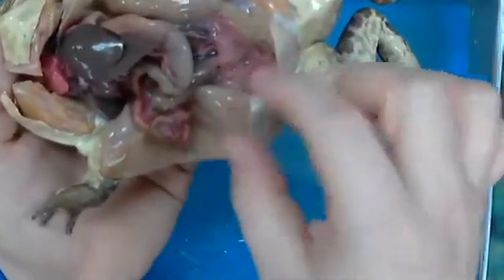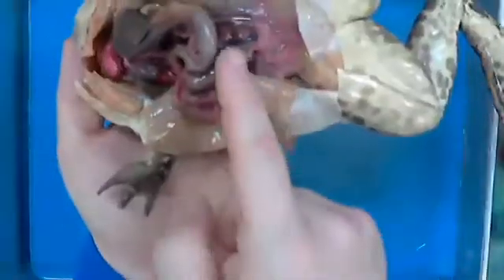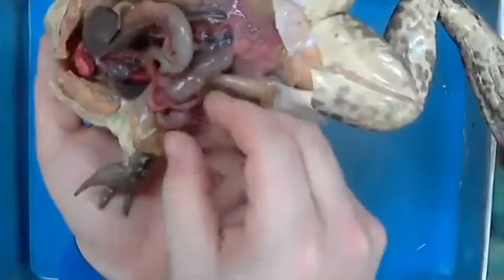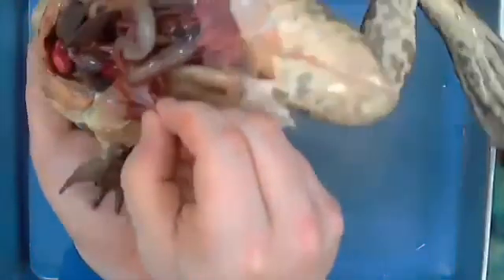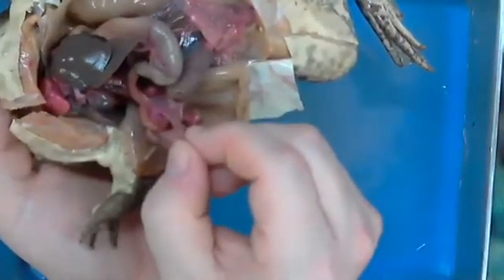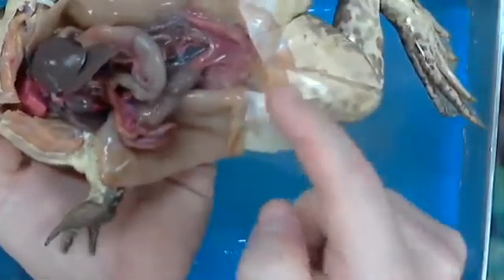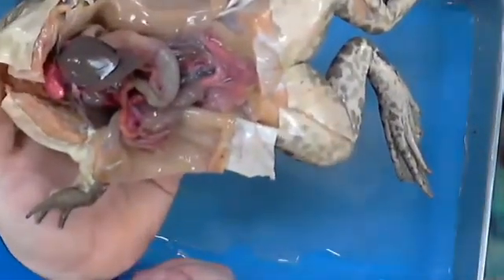And so what would we find at the end of his small intestine? Large intestine, AKA colon. So watch this. Here he is. Look at this. It's attached just like this to the small intestine. You can see the small, it's going straight. I'm going to turn it that way. I'm looking at the camera at the same time. So it's connected straight to this large, which goes where? Where's the large intestine headed? Anus. There we go. The rectum. Right out his backside so that he is emptying all of his waste.